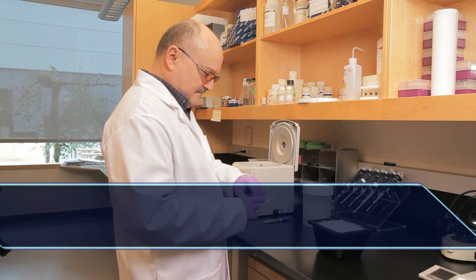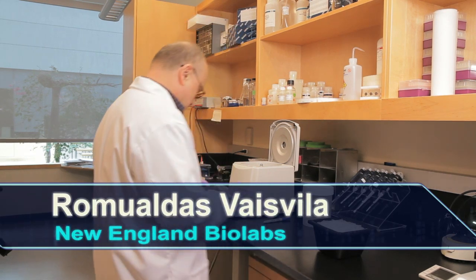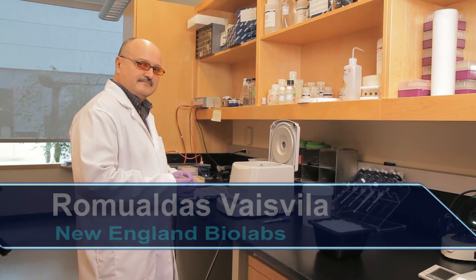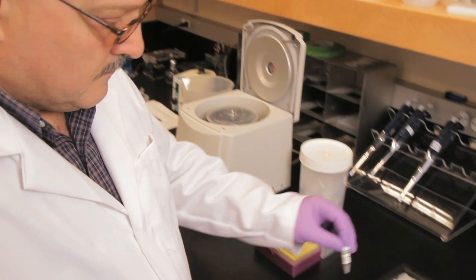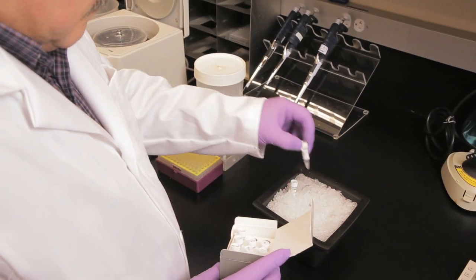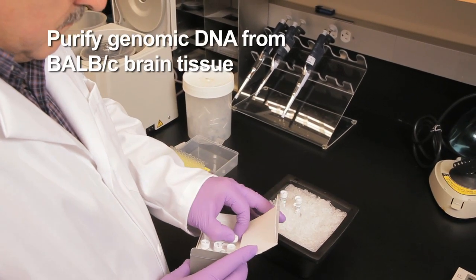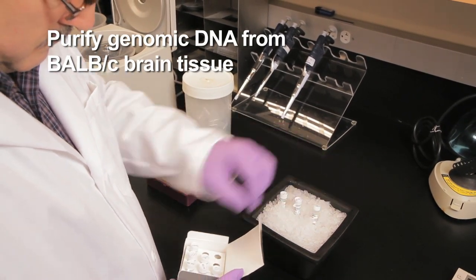Performing the experiments today will be Romas Vaisvila. Romas was a primary developer of this kit at New England Biolabs. Prior to the start of this protocol, purify the genomic DNA from BALB-C brain tissue as described in the written procedure.